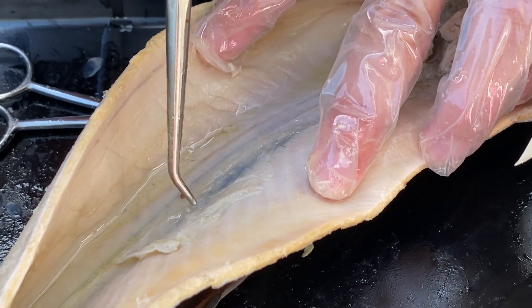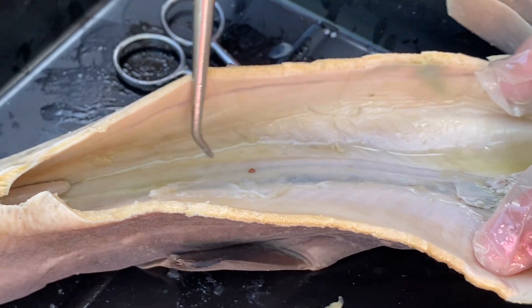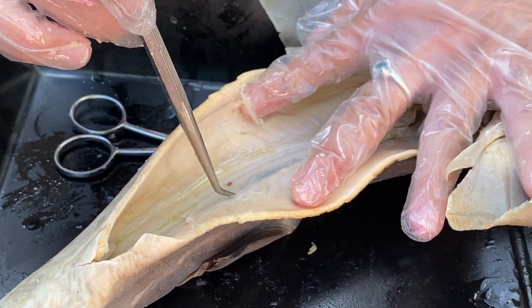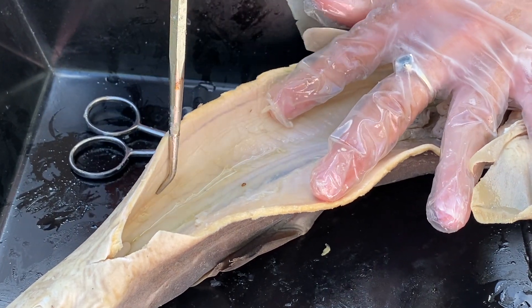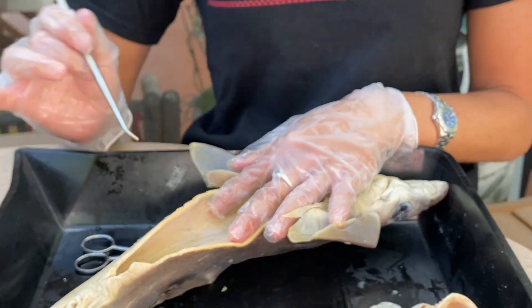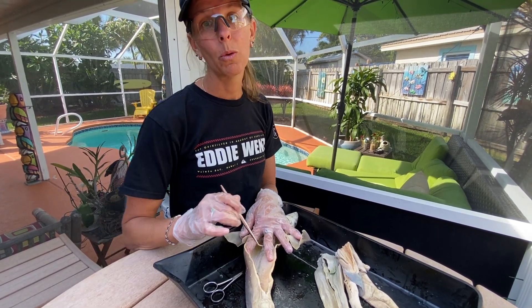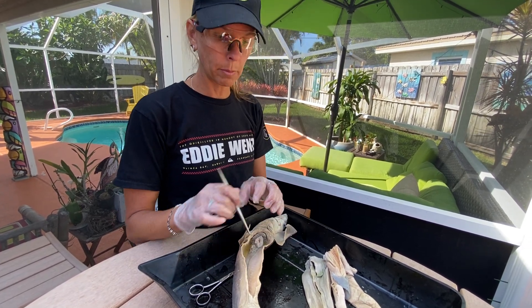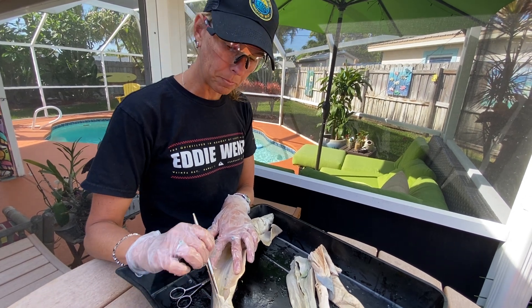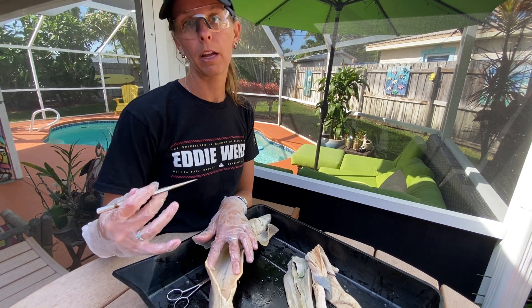She has two uteri. Here's one — it's just like a little bag right here that would fill up. The reason why I know there were two uteri is we used to every once in a while get sent a pregnant dogfish. She would have probably three pups in one uterus and then four — I've only seen a max of seven. These sharks are ovoviviparous, which means it has that two-stage birth where the sharks are actually in an egg case inside and then they hatch out of that. They have a yolk sac. We were able to pull out pups in different stages of development — some were bigger and had smaller yolk sacs because they had already absorbed all the nutrients, and others were smaller and had really big yolk sacs, meaning they were not ready to be birthed. Their gestational period is actually 24 months, so these females are pregnant for two years.